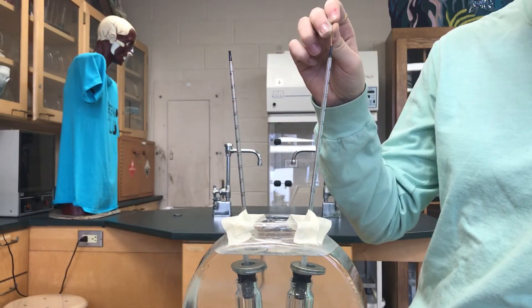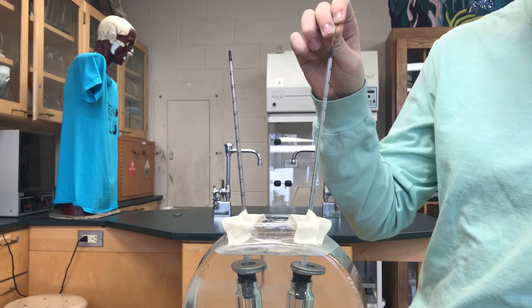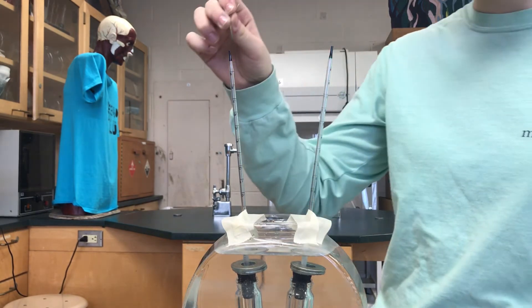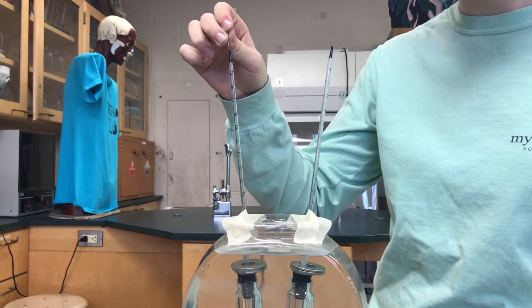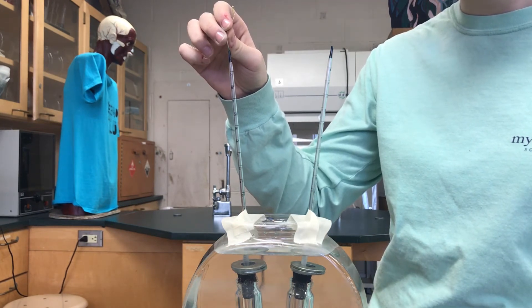Now use a paper clip or a toothpick to push the dye down a little bit to get it started. We feel this is crucial to the experiment and we believe that this is why we had so much success.